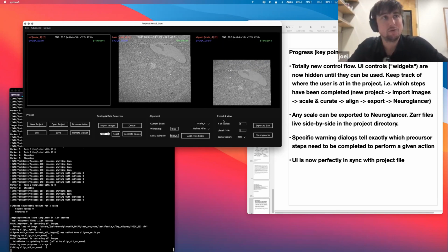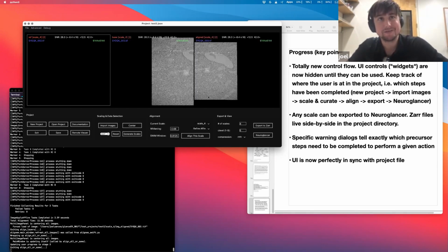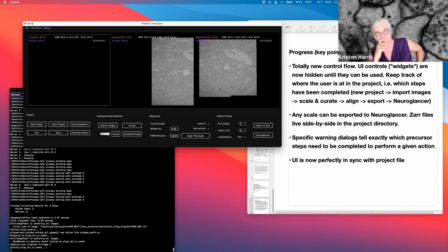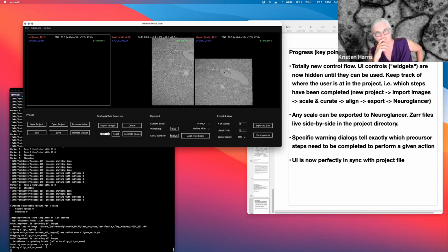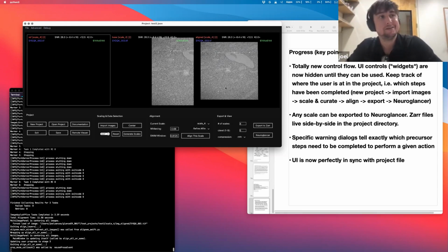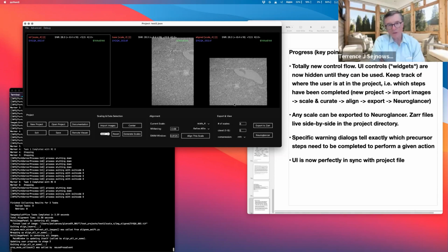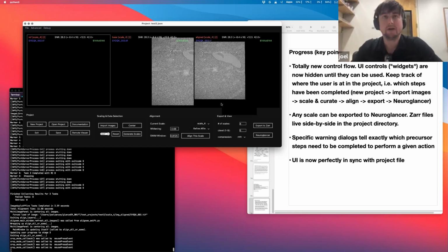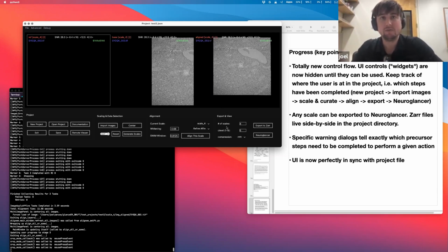You know, I really think the way this all looks really is cool when it's not doing this. It's following my mouse. This is something really silly that I'll probably figure out as soon as we get off this call. So I wish it wasn't doing this because it makes it look kind of... But you could click it. Can't you click it? Yeah, I am clicking it and I tried plugging in a mouse, but I know which part of the code I was working on, and it makes sense that I could get a bug that presents like this.